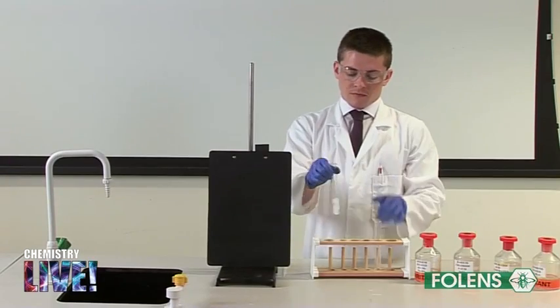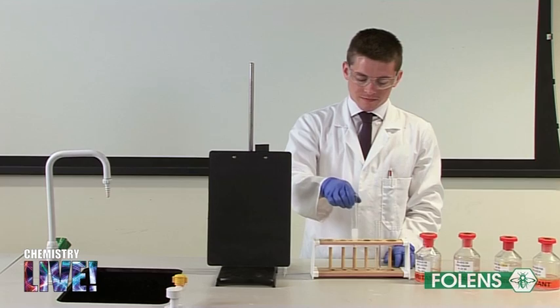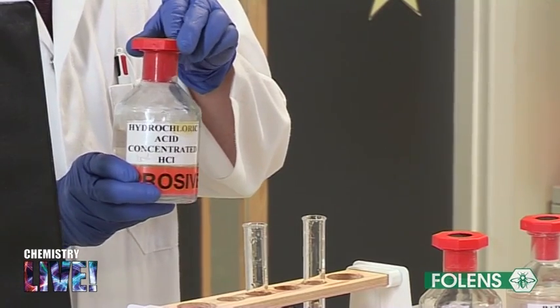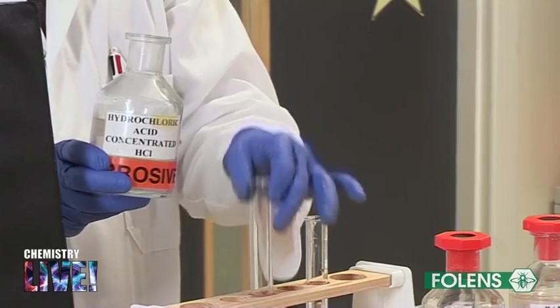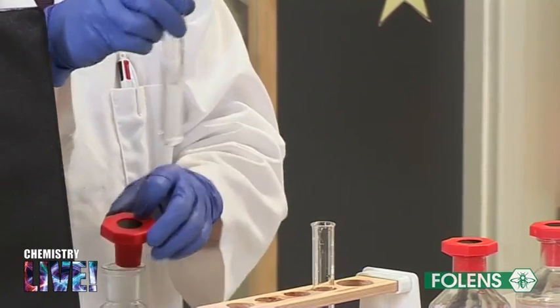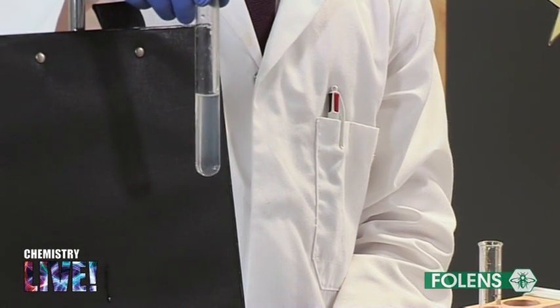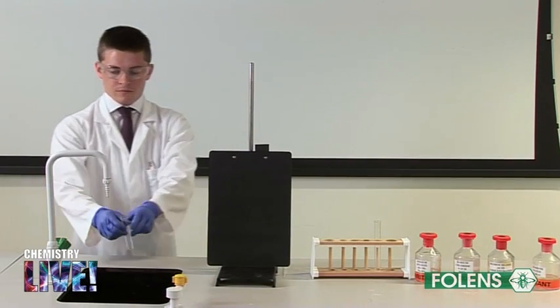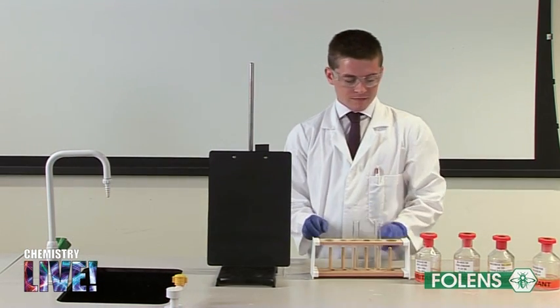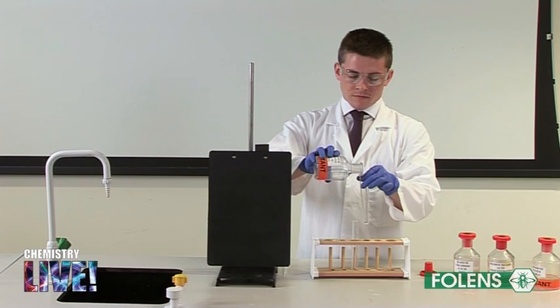A white precipitate forms. If no sulfate ion is present, this should dissolve in hydrochloric acid. Discard the contents of this test tube. To about 1/5 of a test tube of sodium sulfite solution, add the same quantity of chlorine water.